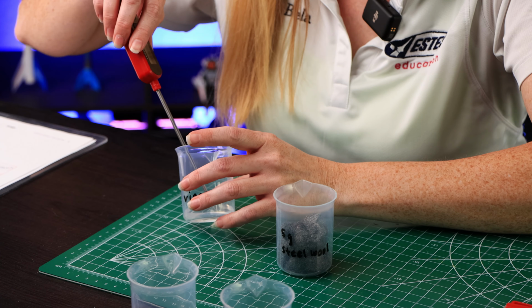We're gonna go ahead and add in the peroxide to the yeast. Then we're gonna wait 1 minute. It's been a minute. Let's check and see if there's been a change in temperature. We have 36.4 degrees Celsius. So we had an increase of 14.2 degrees Celsius.